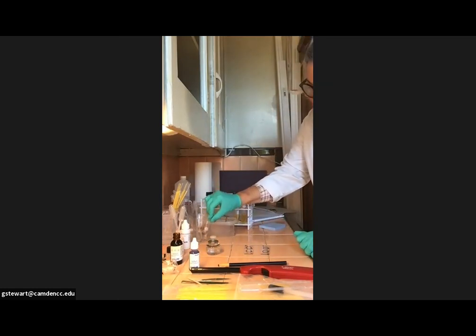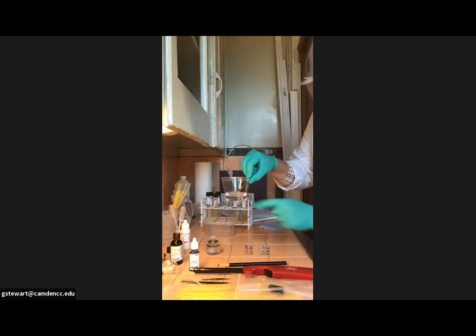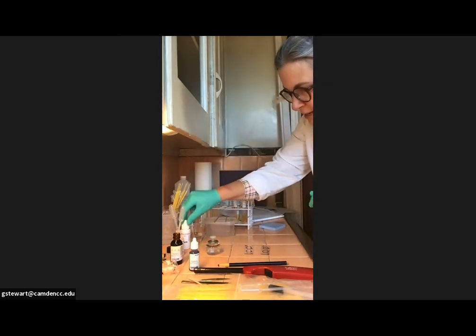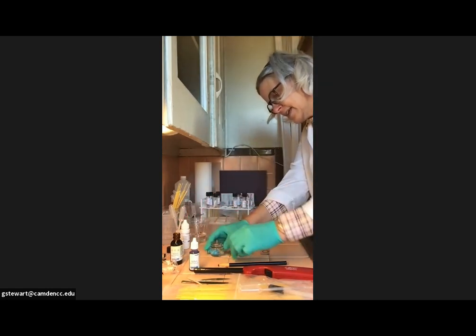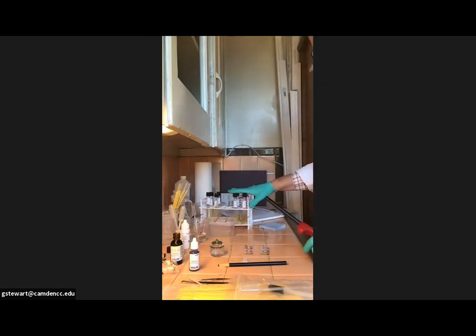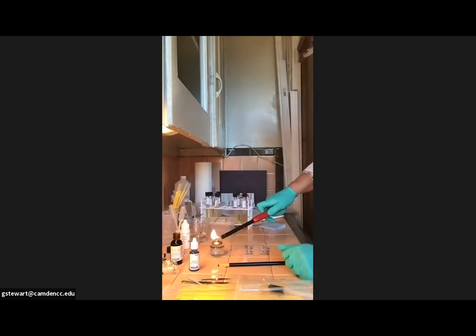So I did go downstairs and pick up my lighter as well as just a plastic cup, and I labeled it DH2O for distilled water rather than using that microscopic wine glass. And then again, I'm going to light my paraffin burner because I am going to need to flame these tubes as I collect bacteria out of them and put them on the slides. So the directions recommend, and I think this is good practice, good lab practice.